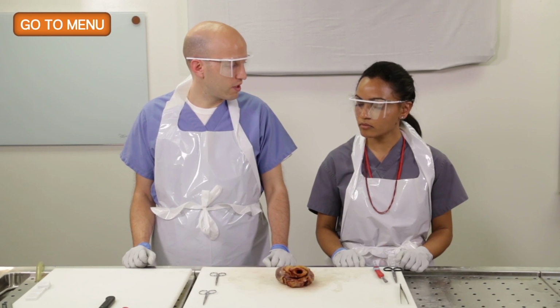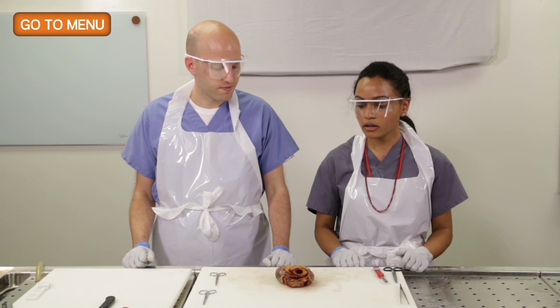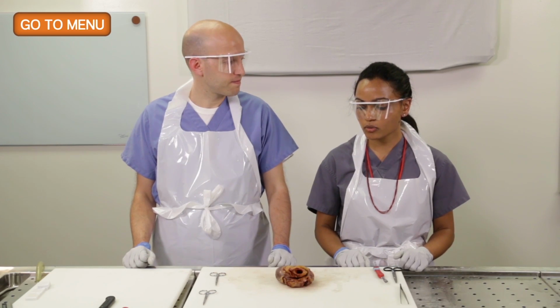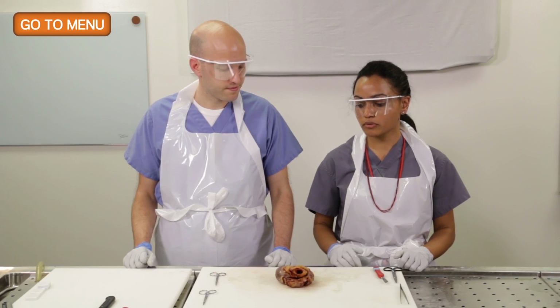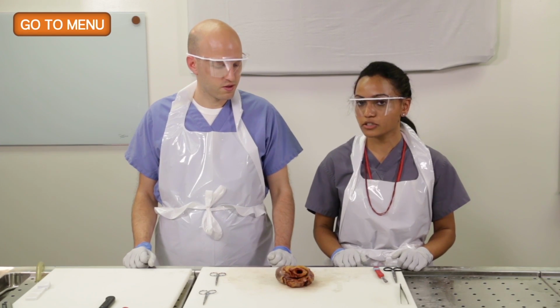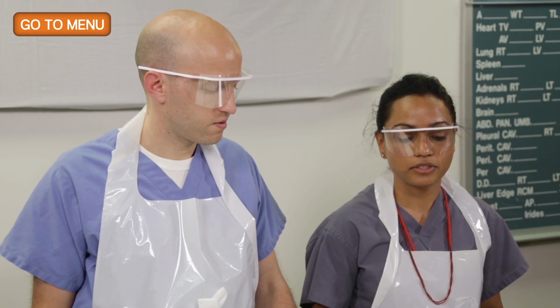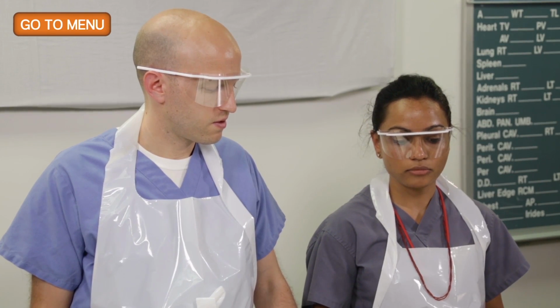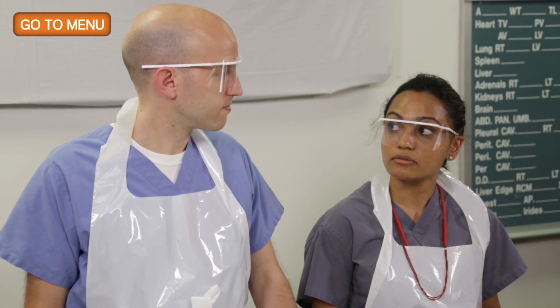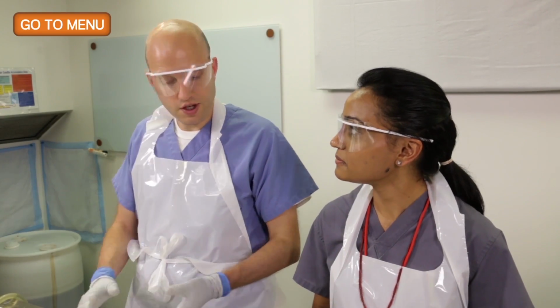Why do we bread loaf the heart in these types of cases? So that we can look at the thickness of the myocardium, and also thoroughly evaluate for ischemic areas, ischemic changes, either pale or hemorrhagic, depending on the timing of the infarction, and also localize which arteries the ischemic event came from. Right, so we see more of the surface area of the ventricle.